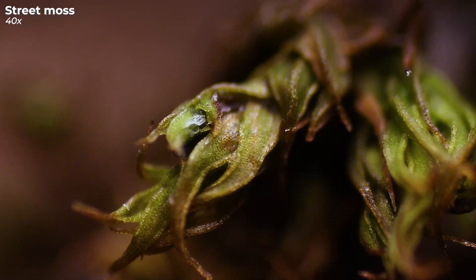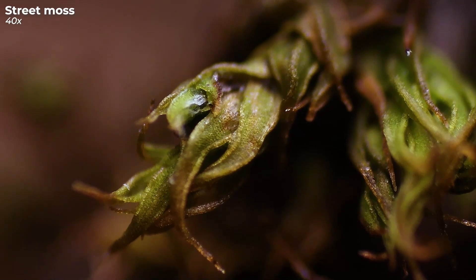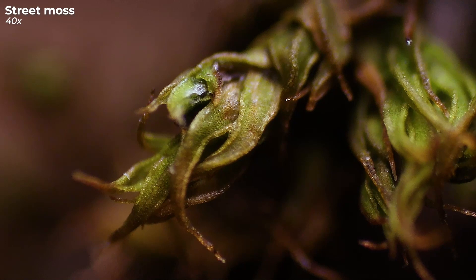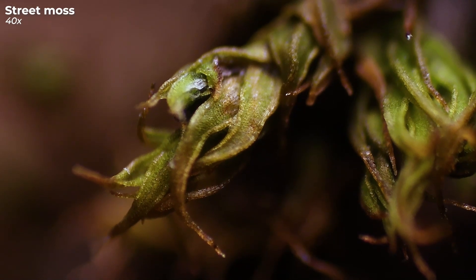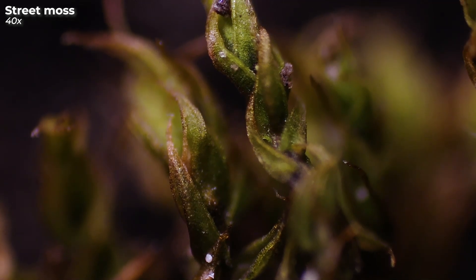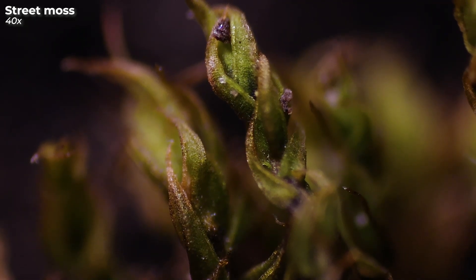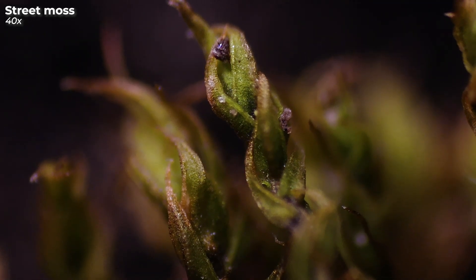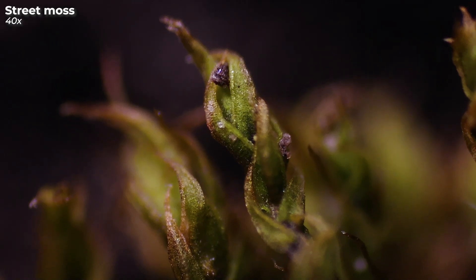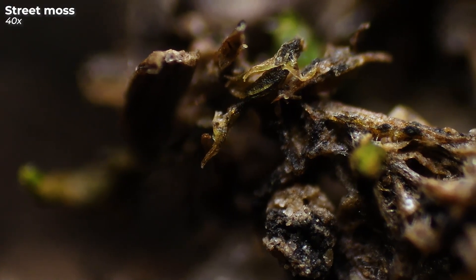There are many different types of mosses and they differ depending on the environment in which they grow. Our collected street moss looks very dried out here. However, it is well adapted to the environment and thus survives periods without rain quite easily. Unlike other plants, mosses do not have roots. They form root-like structures called rhizoids.